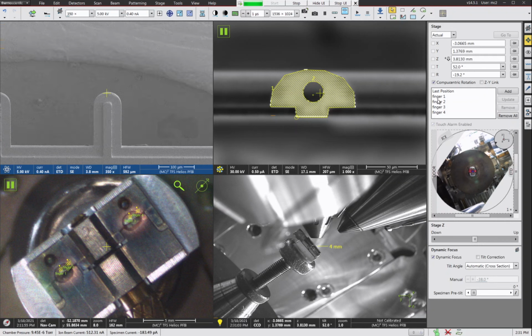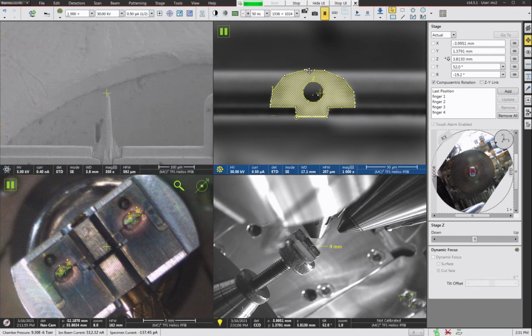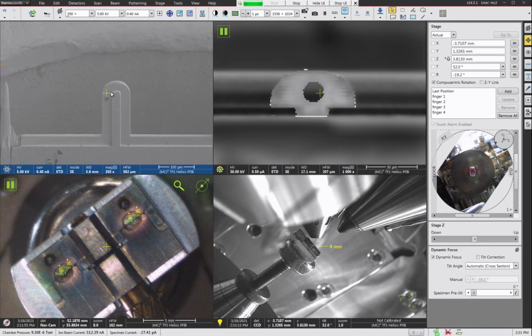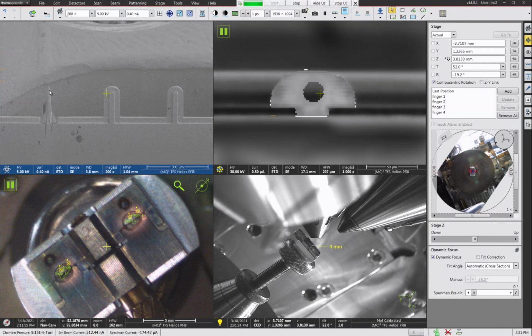The other thing I want to demonstrate, while you're still at the 0.5 microamp beam, is I like to put some kind of a unique notch or feature into one of the copper grid fingers that I'm not going to use. This helps you differentiate the posts when you're in the atom probe. The atom probe can only see the profile of the grid. So all these posts will look the same, and you can't tell if you have the grid one way or the other. So if you cut a mark onto one of these posts, you make the whole grid asymmetric. And then when you're in the atom probe, you can tell which posts you're looking at.